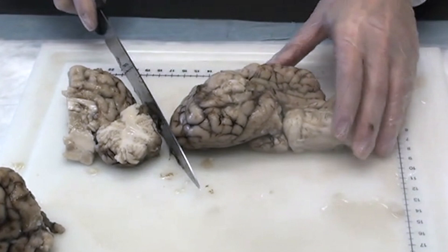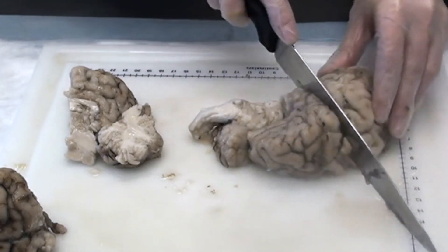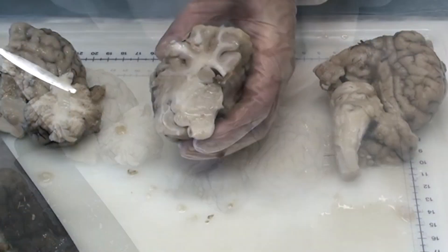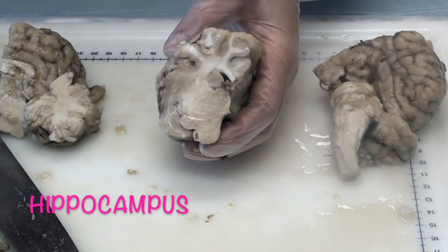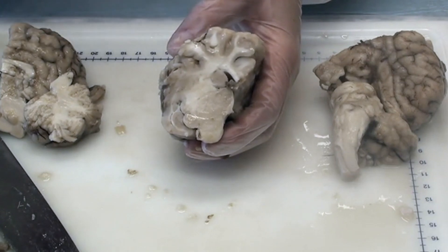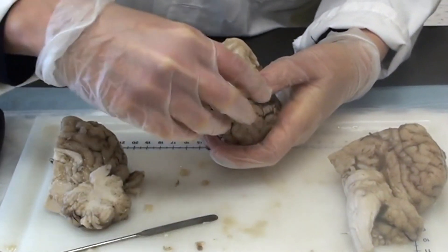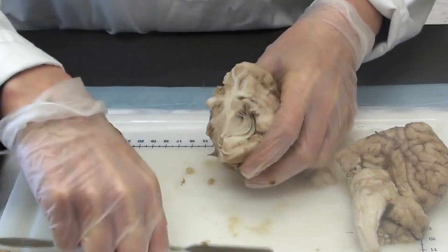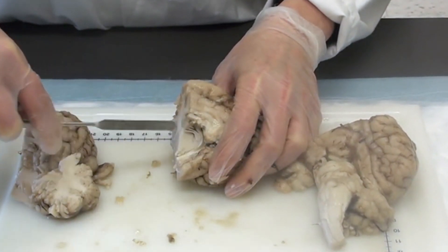Now I'm going to cut the other side of the brain to see what we can see. On this cut again we can see part of the basal ganglia, and then down here this curly structure is called the hippocampus. The brain has two hippocampi — one on the right, one on the left. The hippocampus is very important for memory. Now I'm going to dissect out the thalamus so we can see the hippocampus better. In this view you can see how the hippocampus is a long tube that goes from the temporal lobe and then sends fibers up to project to the rest of the brain.